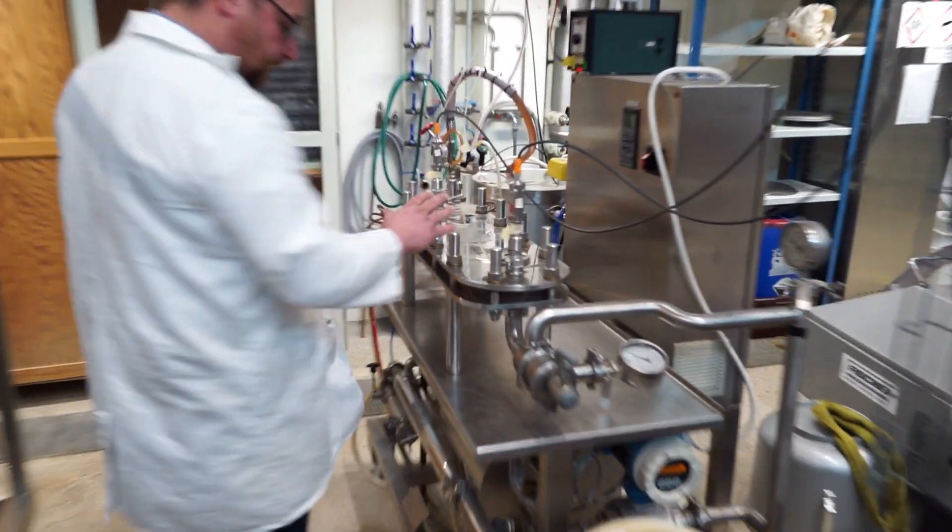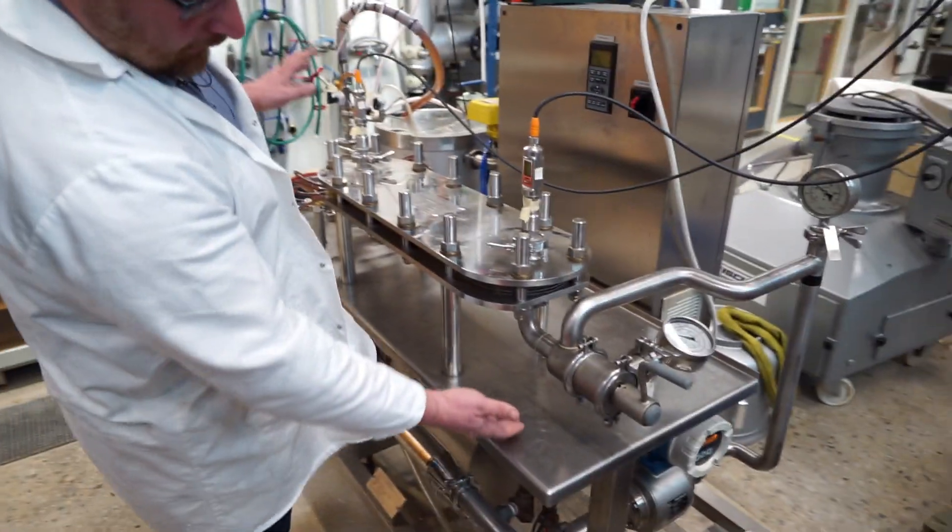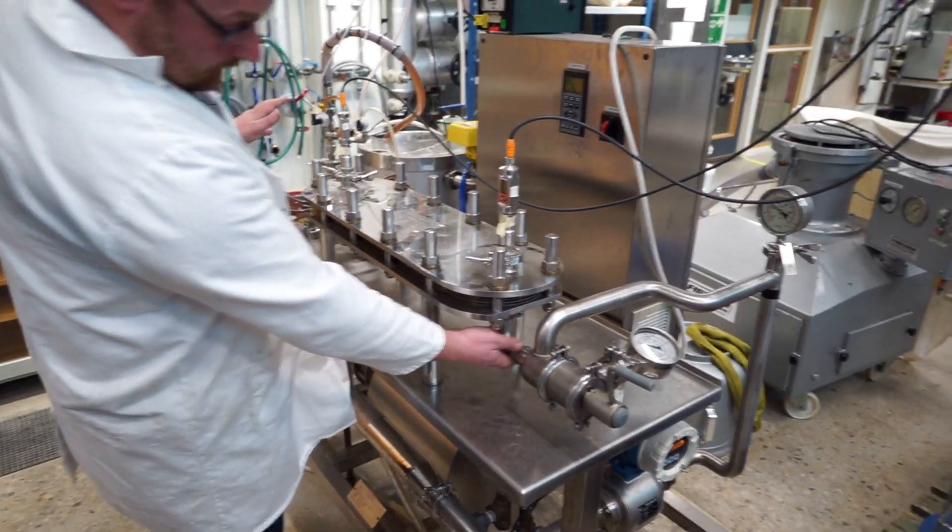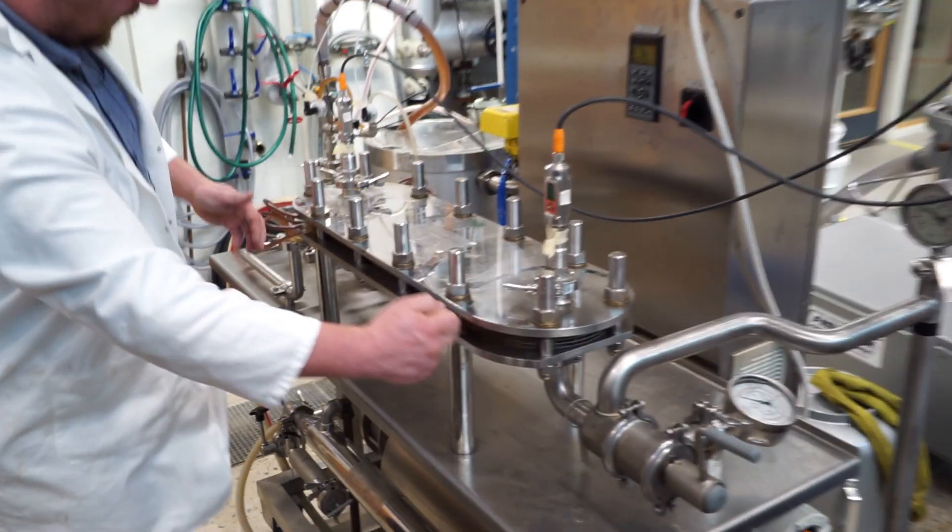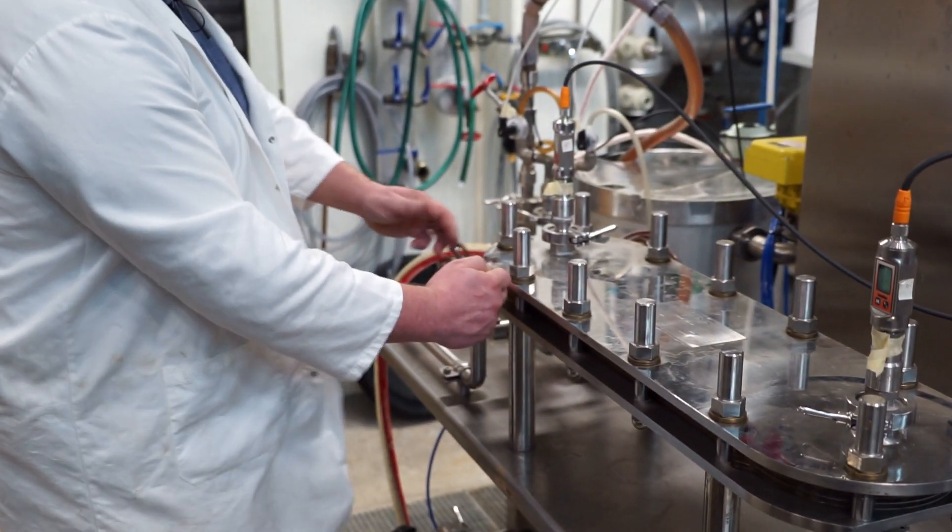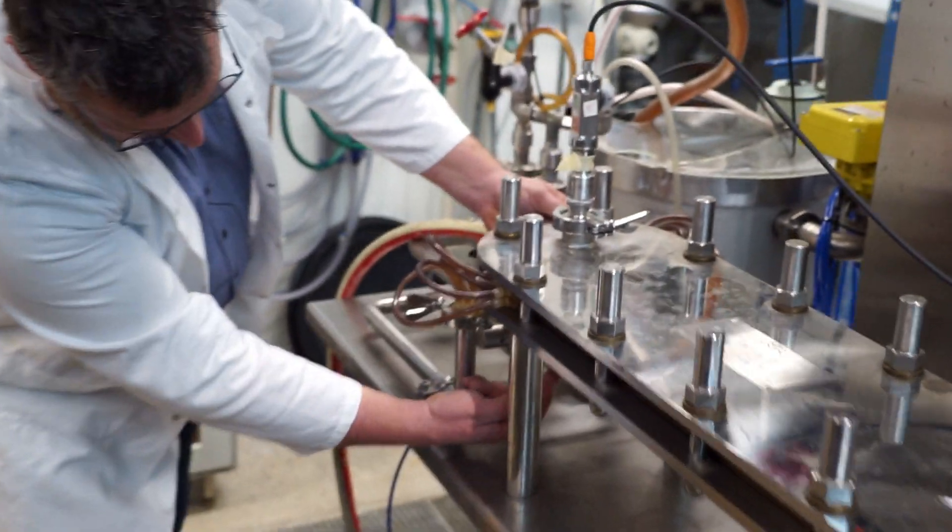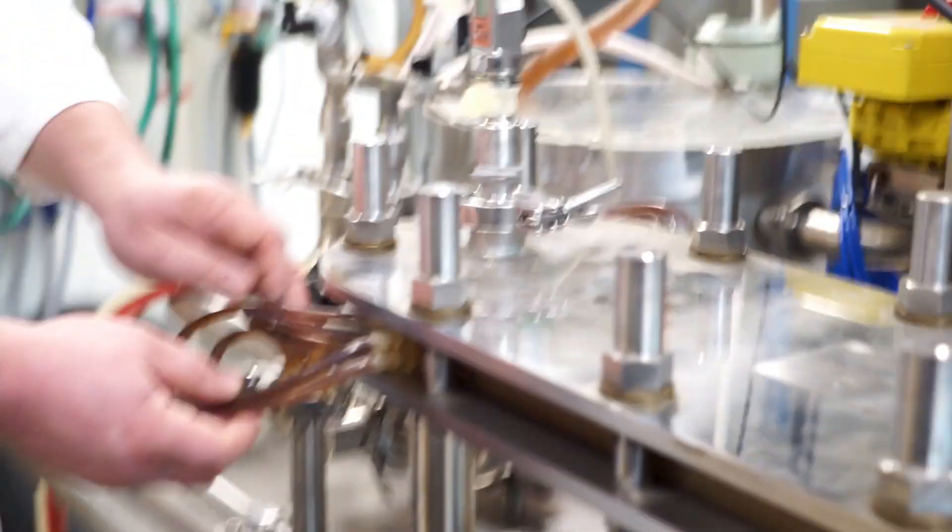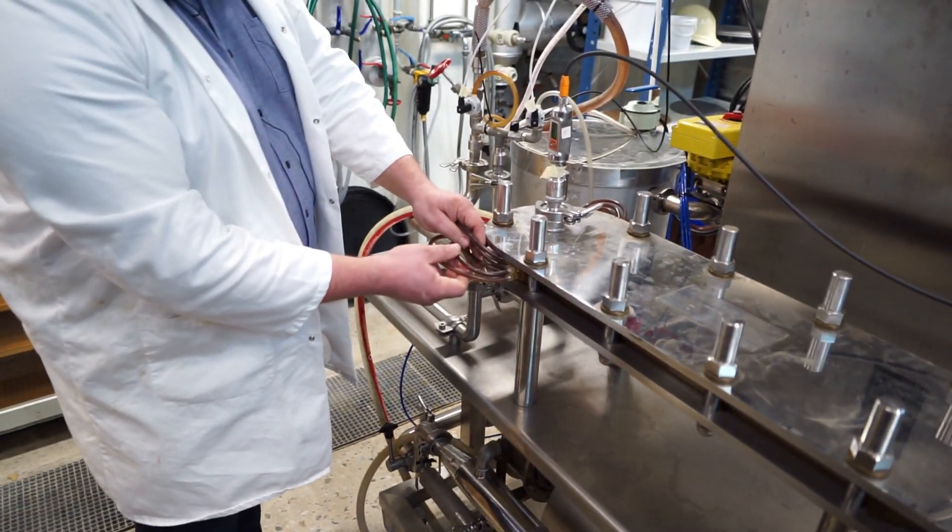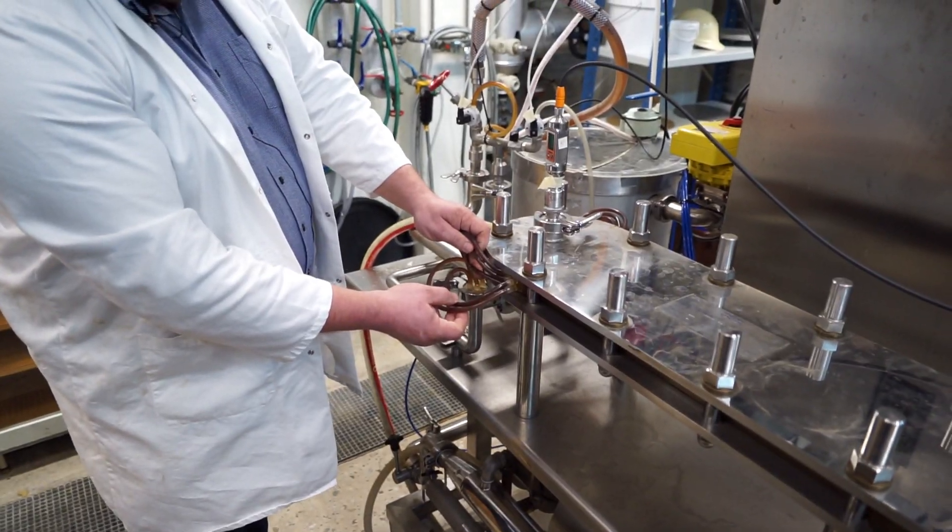Yes, I'll show you. We have the inlet flow here. It goes in here, goes through the membrane, and comes out here through that tube. So down there.